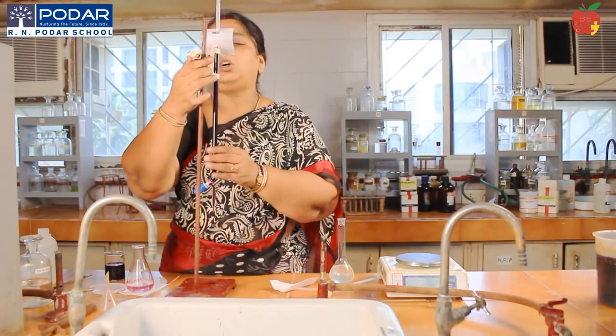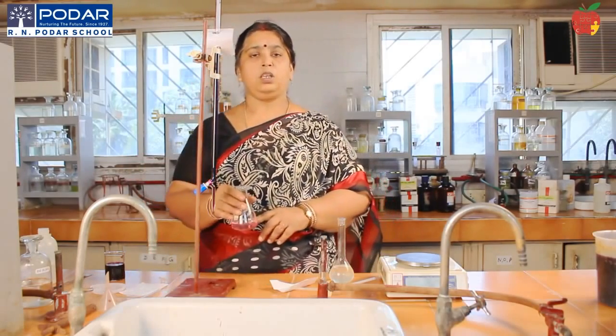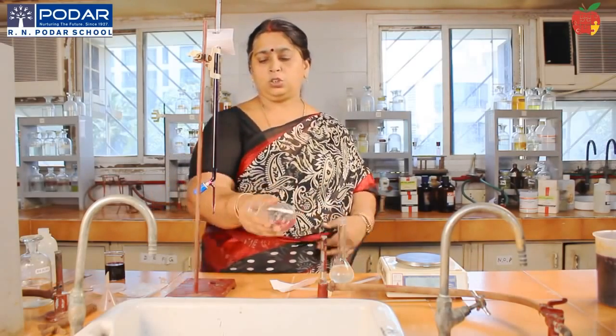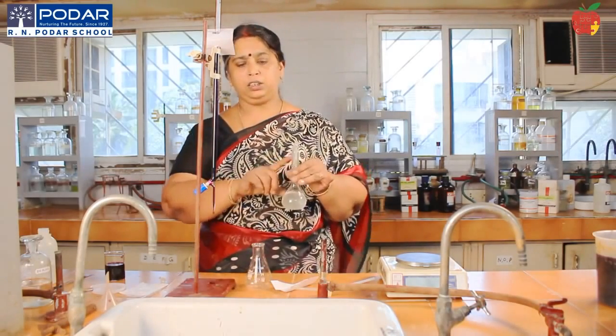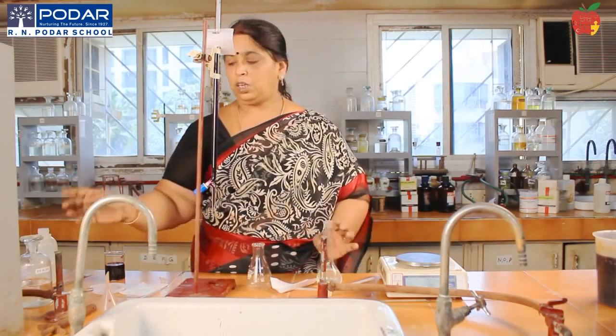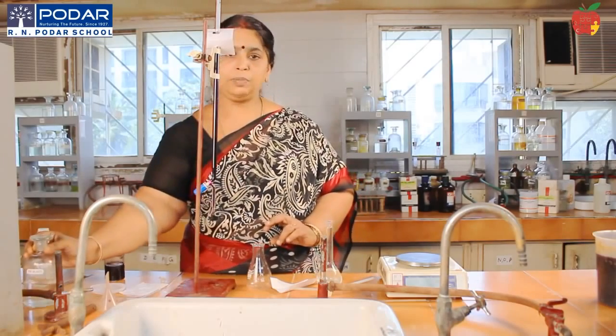Okay, fine. Now my experimental part is over. Now the same procedure I will repeat till I get a concordant reading. So I'll throw it off. I'll wash my conical flask, pipette out again 10 ml into the clean conical flask, add 10 ml, 1 test tube of dilute sulfuric acid, and repeat the same experiment.